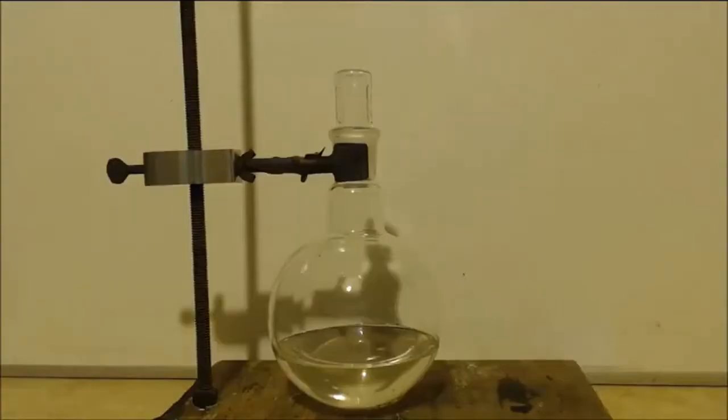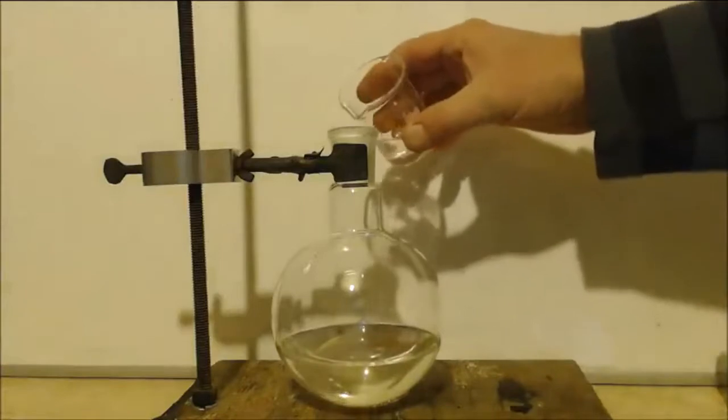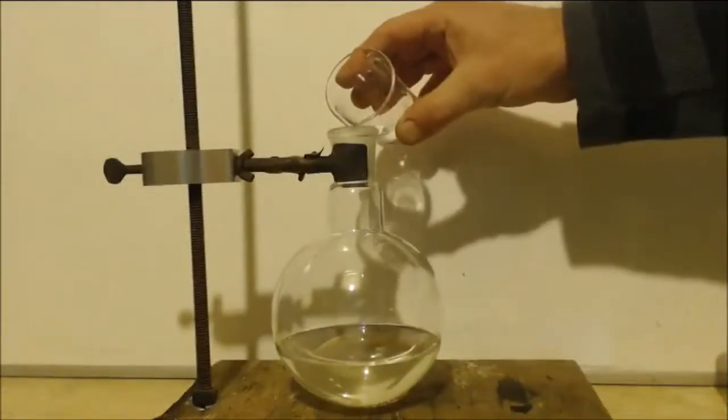But anyways, this next thing, basically I got to give it to Nerd Rage because I never would have figured this one out. Is to put some sulfuric acid in there. So I'm going to pour 10 milliliters of sulfuric acid in there, just a little at a time.